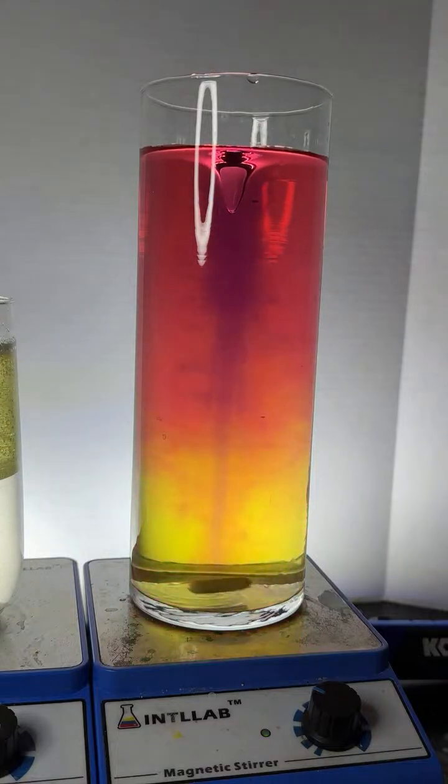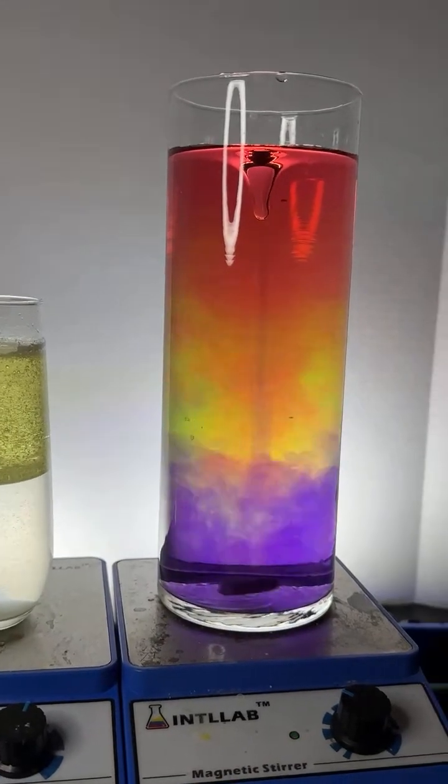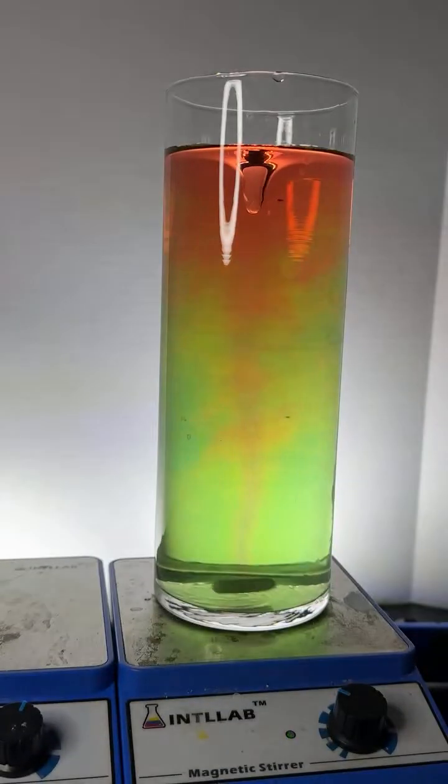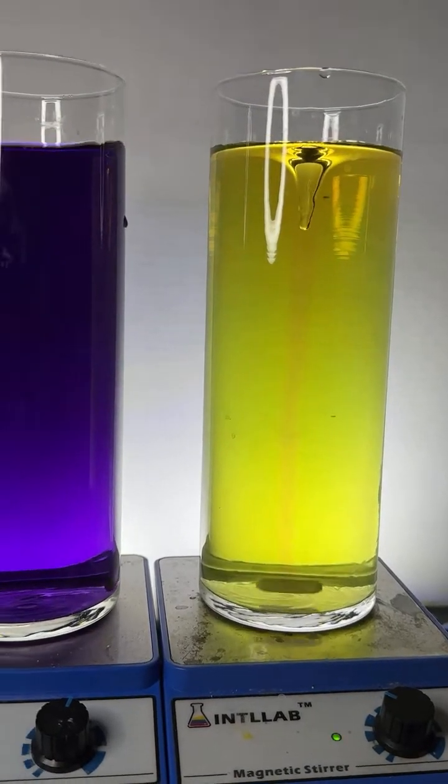I think we're going to do, roughly speaking, I'm doing a little bit of math in my head. It may be as low as 1/10, but all right, here we go. Let's put this on here.